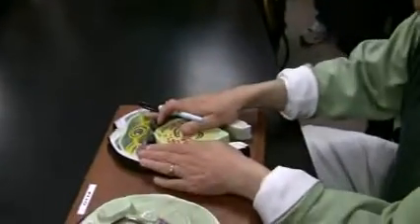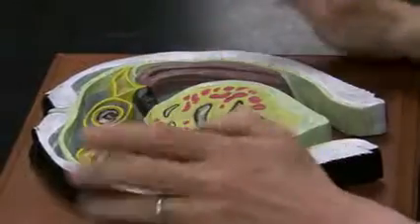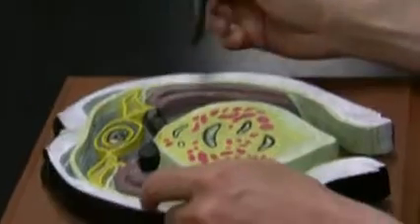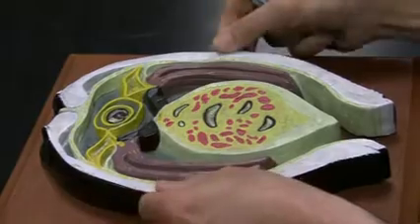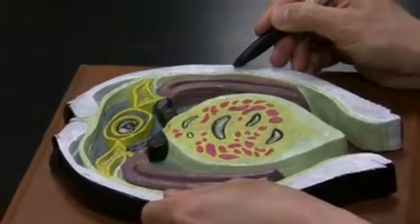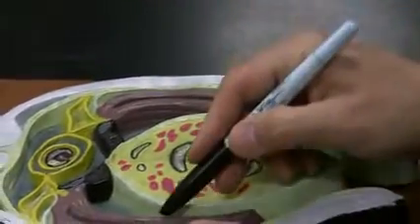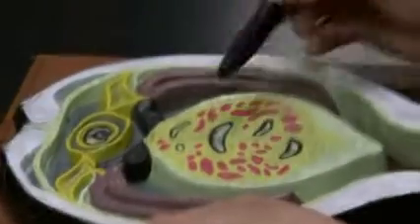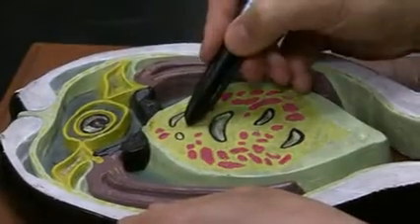Cross section, you do have slide of this. You do have slide, it's not online. The slide of this is not online, but you do have slide of it in your slides. It says clam gill. Okay, so two gills, mantle here, of course shell, sorry about that. From here to here is shell. This light green with yellow dots in it, you see that? That's mantle. Gills, foot, mantle, shell. In the foot, intestine. These are intestine. Blood vessels. The yellow is gonad.